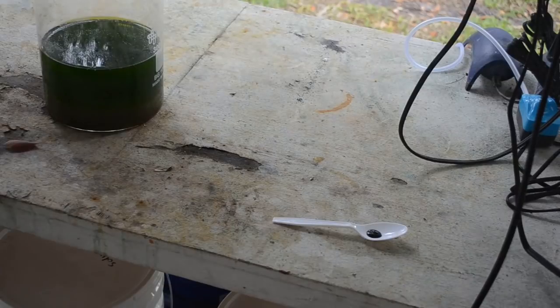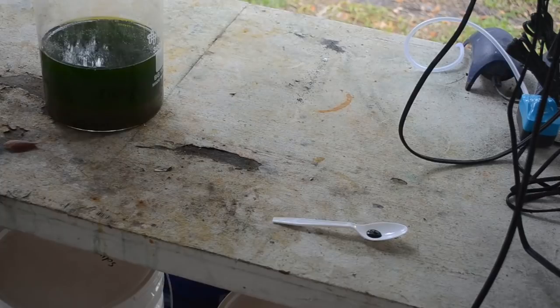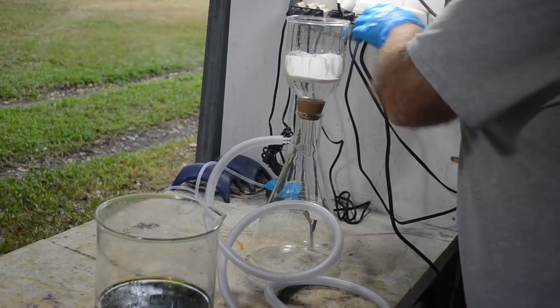And I think I'm definitely going to concentrate the second half of this batch with the sluice before I run it, just because there's too much material to process really efficiently. So yeah, I'll have to bust the sluice out and sluice that material before I run it. So let me set up for filtration. We'll get this stuff filtered, and then we'll start a second extraction on it. Alright, let's get to filtering this stuff. Let's see if I can do it without making a horrible mess.